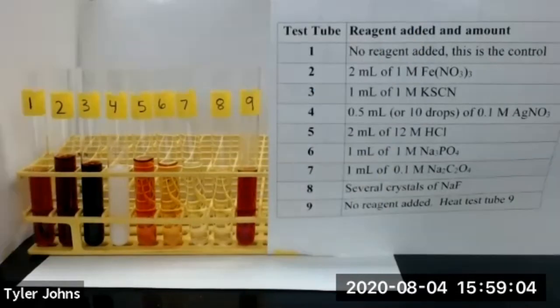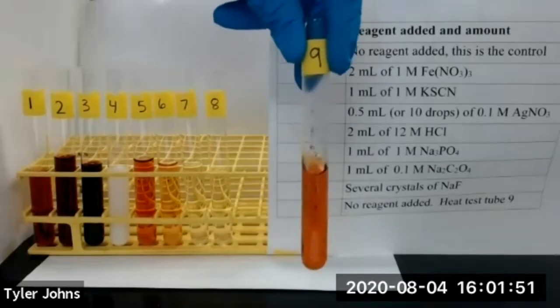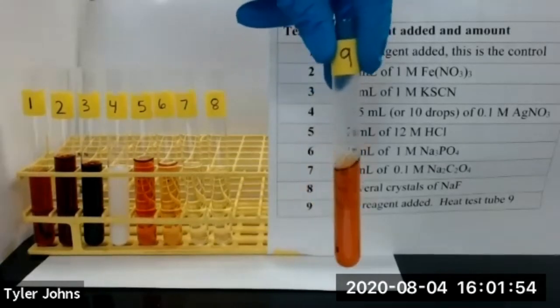We now need to heat test tube number nine in a hot water bath. We've now heated test tube number nine in a hot water bath.